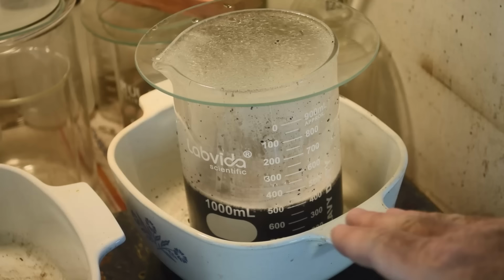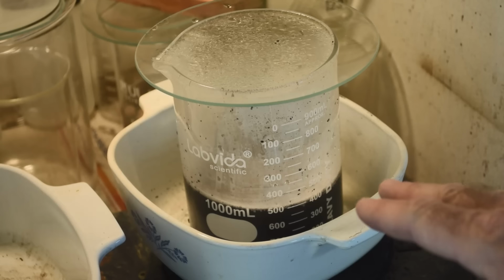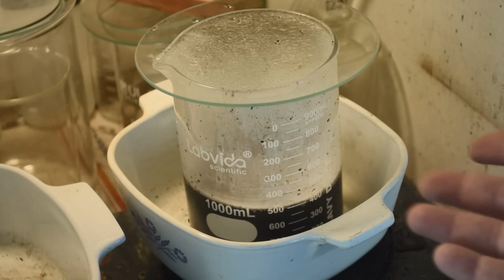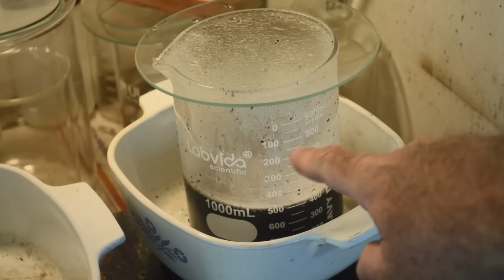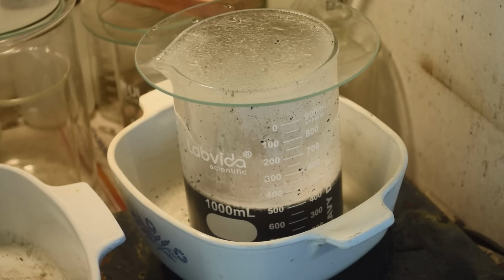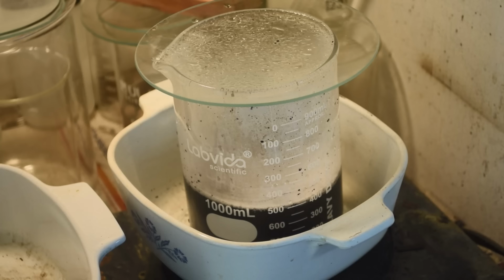Still, whatever little bit of barren liquid is in here containing ammonium formate, whatever else might be in there after the reaction, it wants to foam up really badly. As soon as this stuff comes up to a boil, it starts heading for the top of the beaker. So I don't know what's going on. You can see I've got some palladium stuck to the inside of the beaker where it's foamed up on me once already. So I've got to watch this stuff like a hawk, or I'm going to have all my palladium in my Corningware dish again.